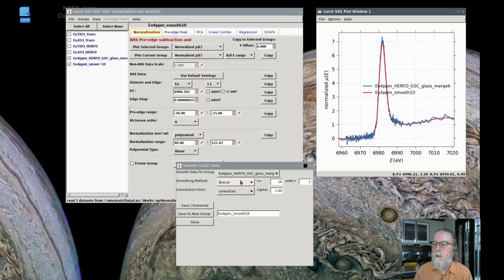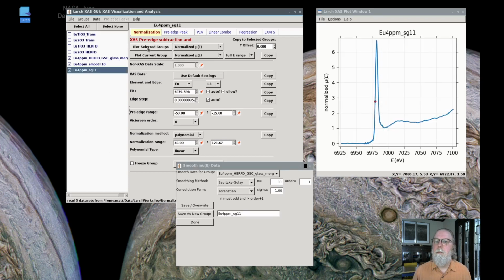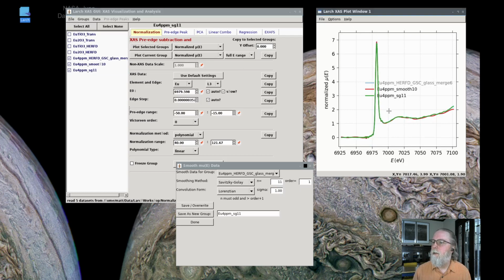That's pretty good. There is another method for smoothing data, the Savitzky-Golay method, which uses both of these n and order parameters. This method, strictly speaking, requires that the data be evenly spaced in energy. You can apply it anyway and hope for the best, and we often find that it works out reasonably well. So here I can say that that's Savitzky-Golay smoothed with those parameters, and I can save that as a new data set. Now if I plot all three of them together, the differences between those two are pretty minor, and which one did the better job of smoothing you can argue about all you want.